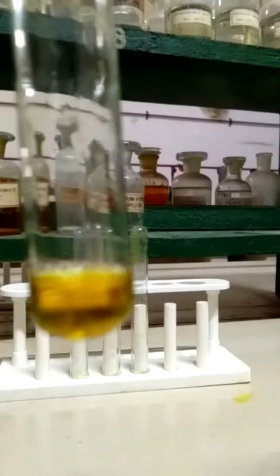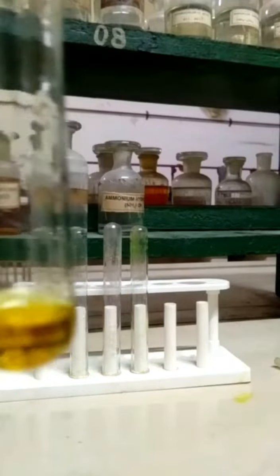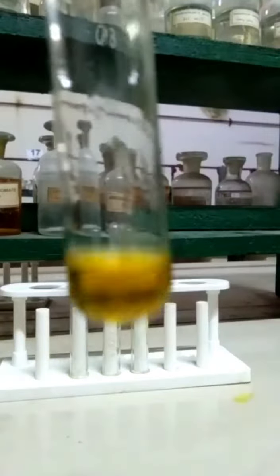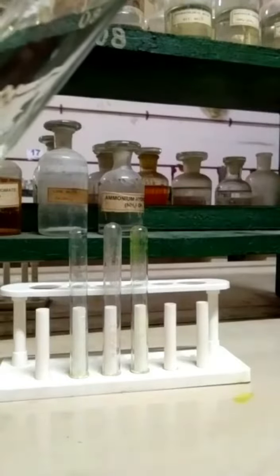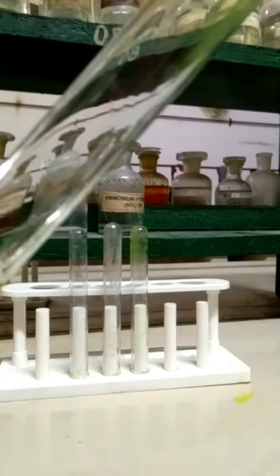Now let us perform the DNP test in the given organic sample. Here is a small quantity of DNP reagent taken in a test tube. I am adding a few drops of organic compound into it. Record the observation.